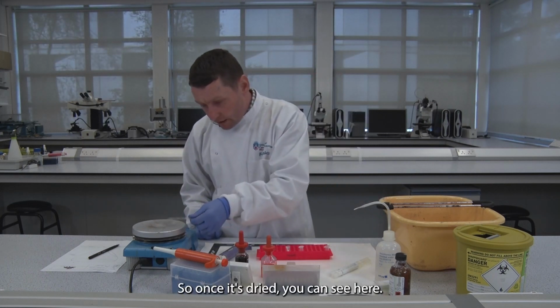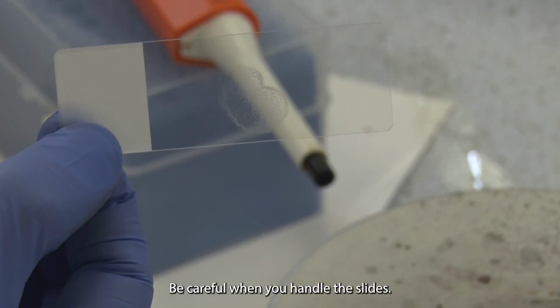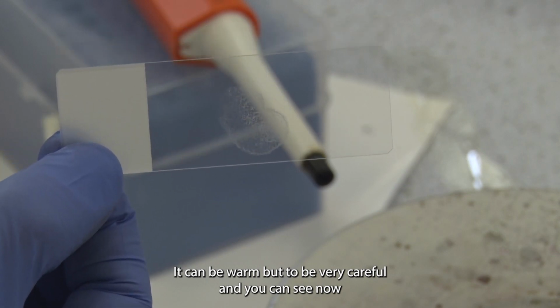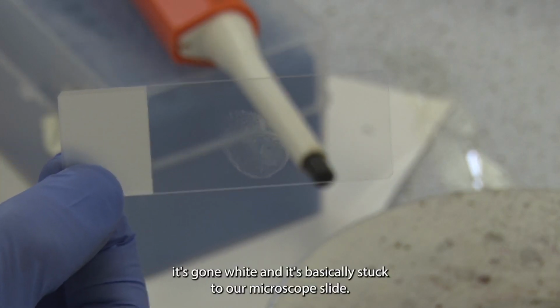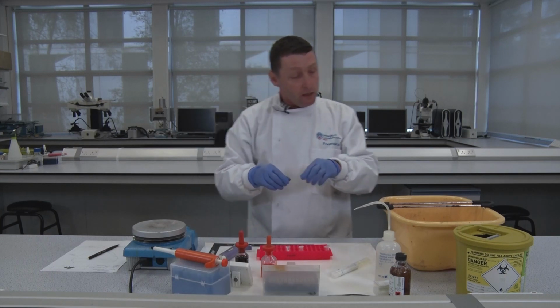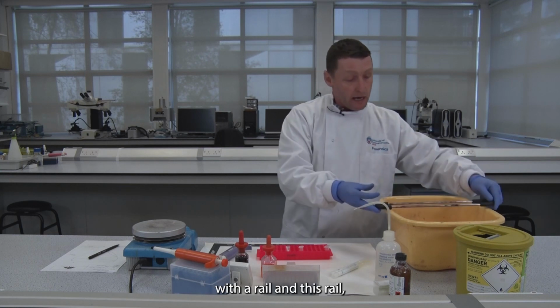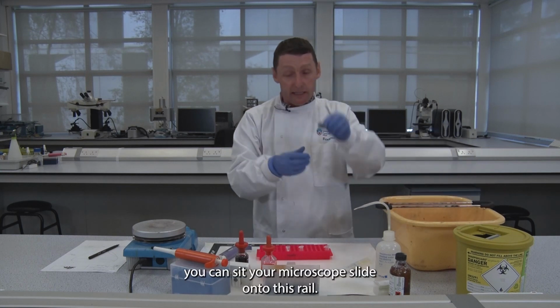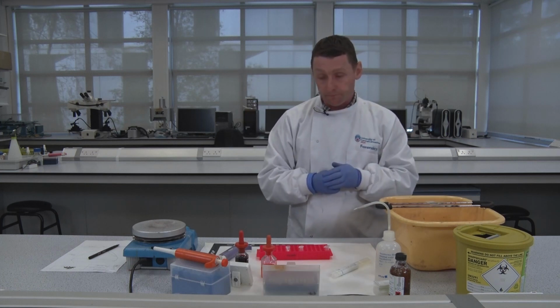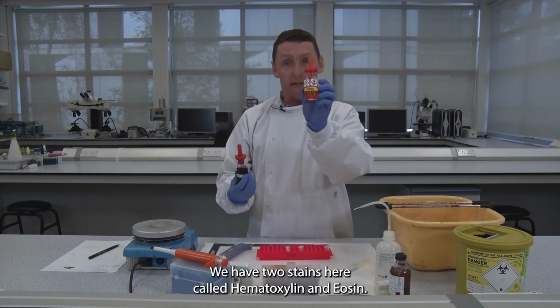Once it's dried, you can see here, be careful when you handle these slides, they can be warm. You can see now it's gone white and it's basically stuck to our microscope slide. We have a washing up bowl here with a rail, and you can sit your microscope slide onto this rail. We have two stains here called hematoxylin and eosin.